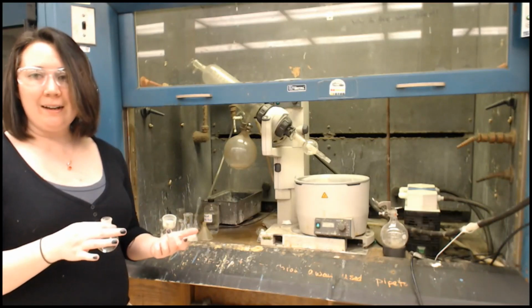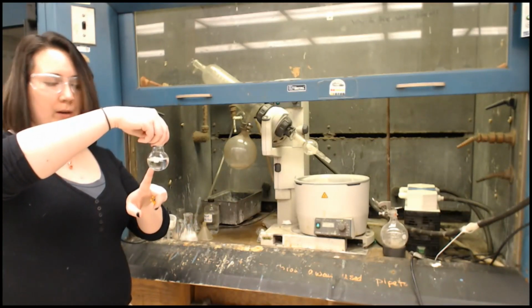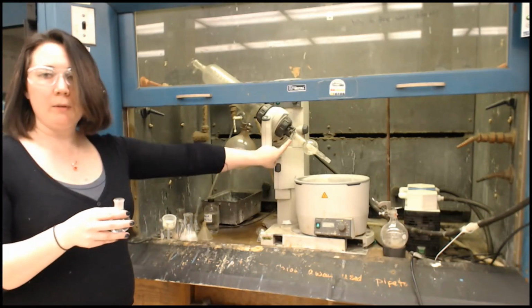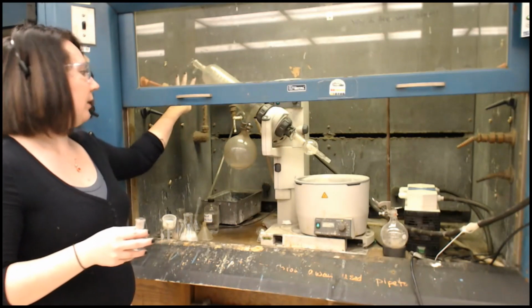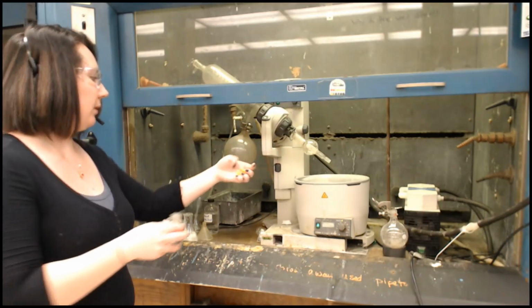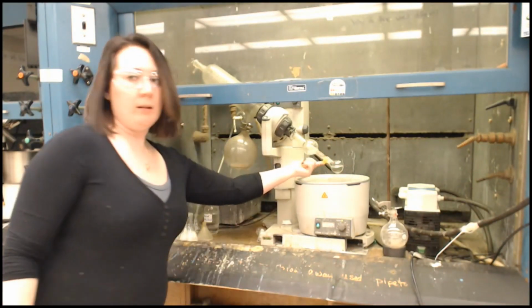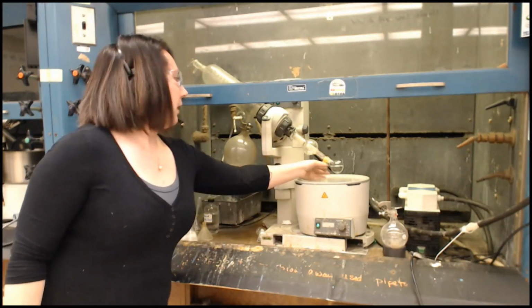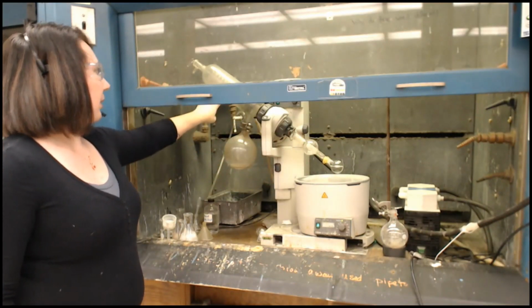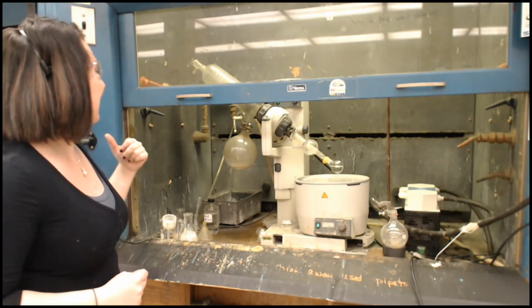Okay, hey guys, so I have our ethyl acetate with our compound right here, and I'm just going to put it on our rotovap. It's basically just a very large vacuum distillator. So first thing I'm going to do is clip it onto the end here. I want to use a keck clip, that way it's not going anywhere. And then what I need to do is make sure there's water running in the condenser. And there is. I can hear it running behind me.